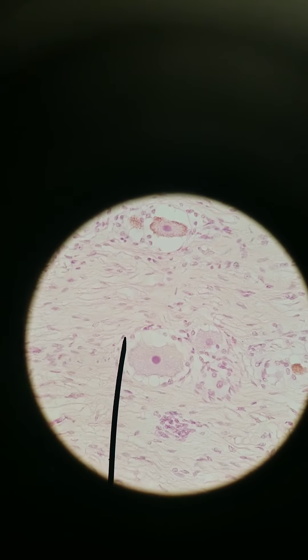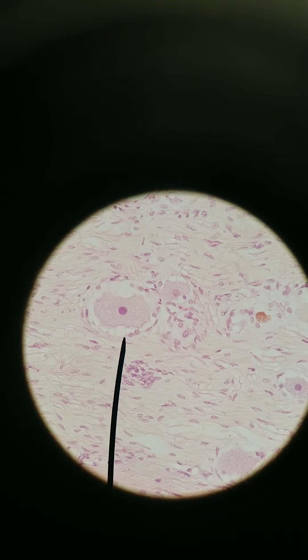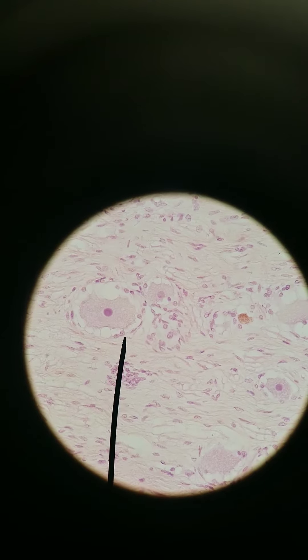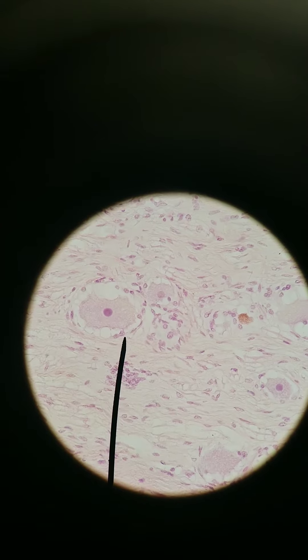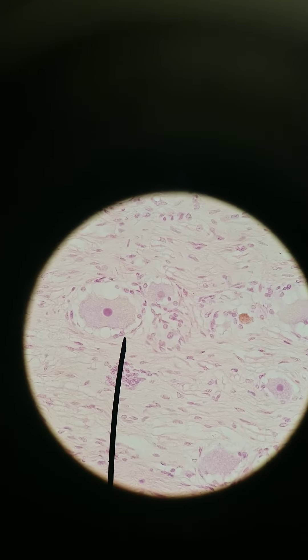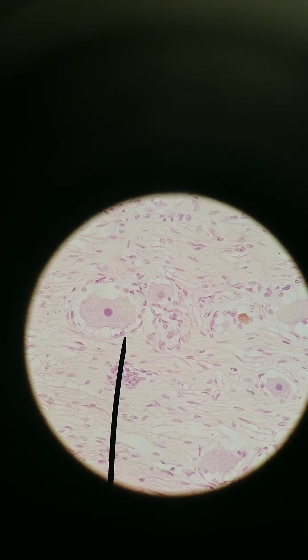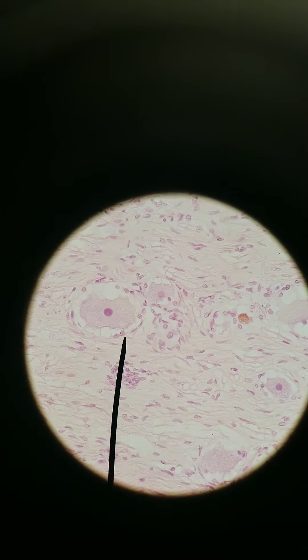Back to the cell bodies, you can see a bunch of cells circling them. See these smaller nuclei that are circling the neuronal cell bodies? Those are called satellite cells. Satellite cells are to peripheral neurons as astrocytes are to central nervous system neurons. They're there to support the neurons — clean things up, provide nutrients, things like that.